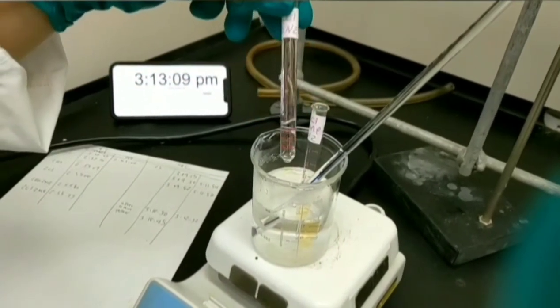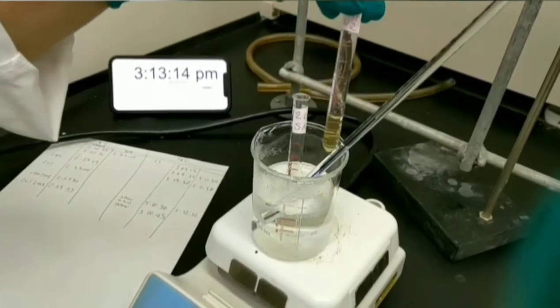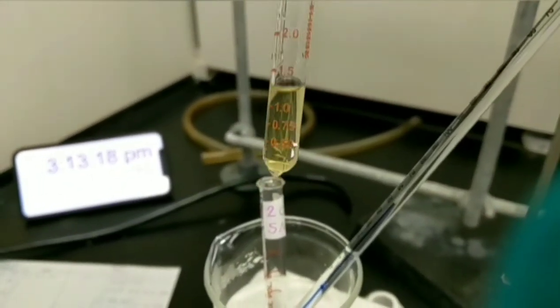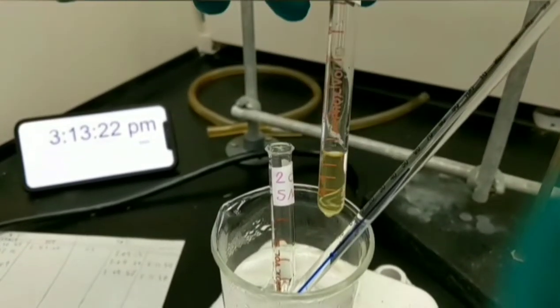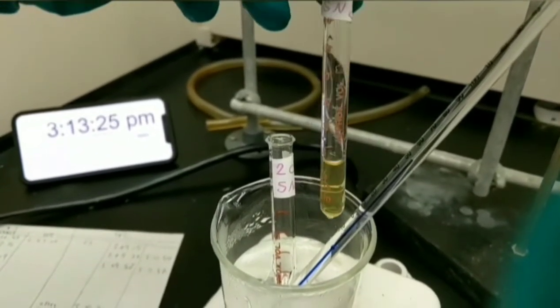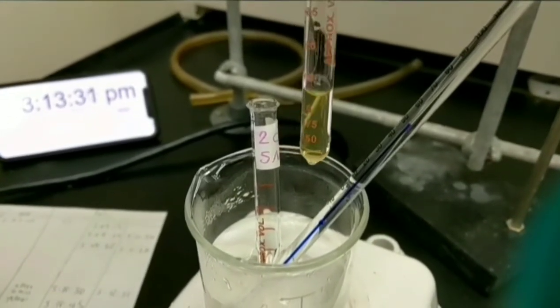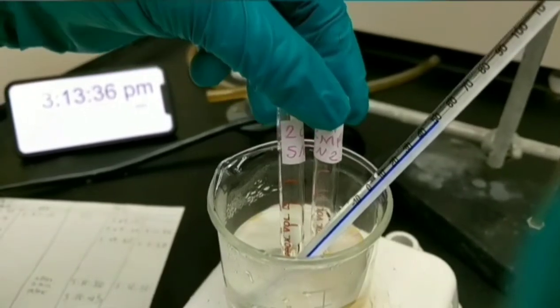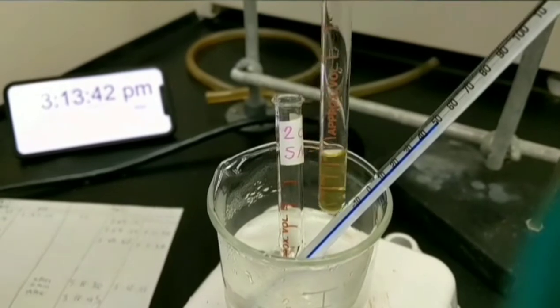We still don't have any precipitation for 2-chlorobutane, but 2-chloro-2-methylpropane seems cloudy. This reaction has already occurred in room temperature, so you don't need to record a new time. You can explain that a higher temperature increases the progression of the reaction, so the reaction makes a cloudy and darker yellow solution.